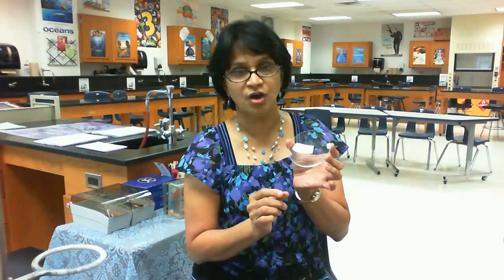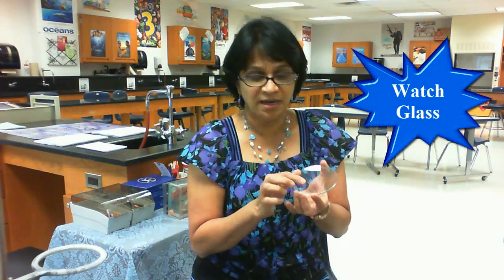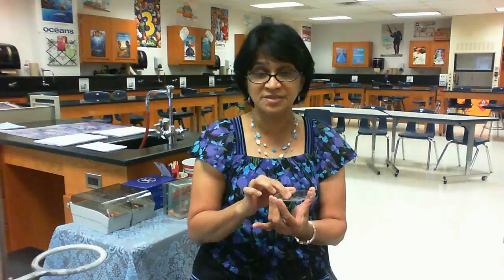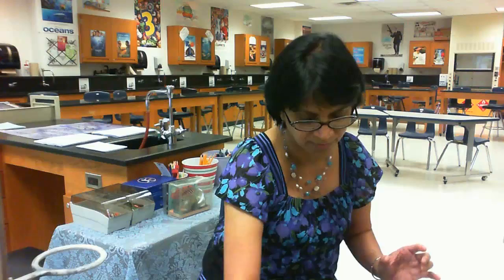Coming back to something called a watch glass — it looks like a glass plate. It is a shallow, concave plate that can be used for keeping or measuring some materials. We can also use it as a lid over a beaker to protect liquids for a short time.